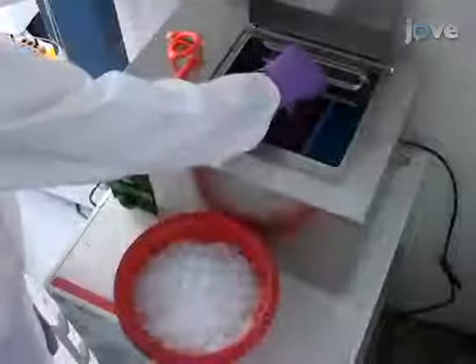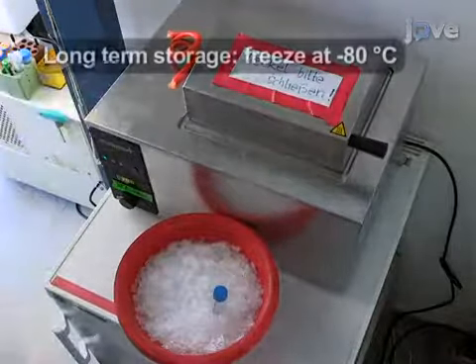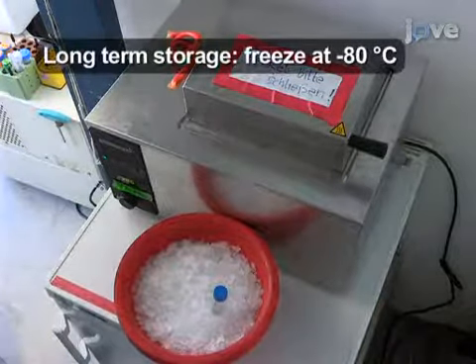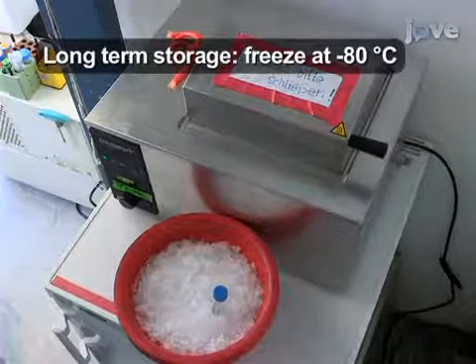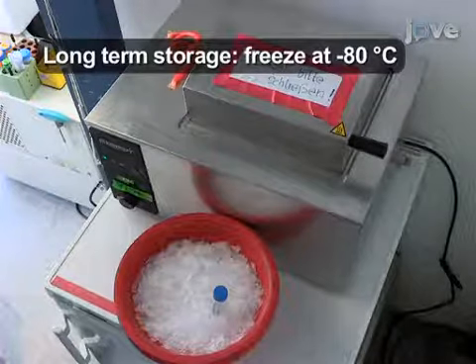Keep all virus lysates on ice if they'll be used within a day. For long-term storage, freeze them at -80 degrees Celsius. Keep in mind that any additional freeze-thaw cycles will reduce the virus titer by 30 to 50%.